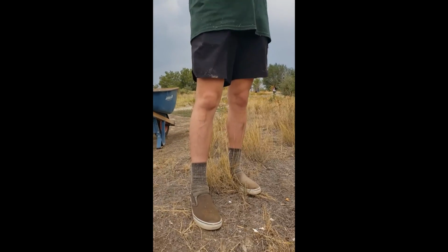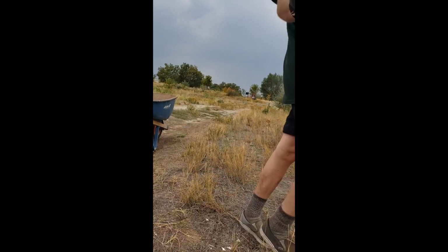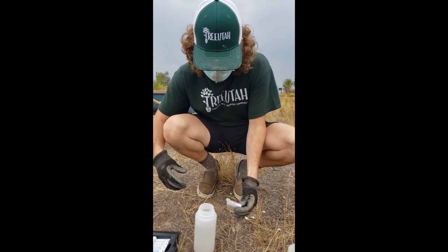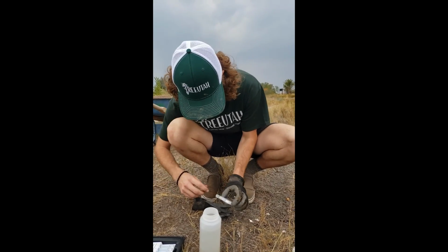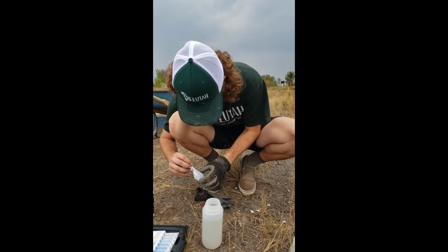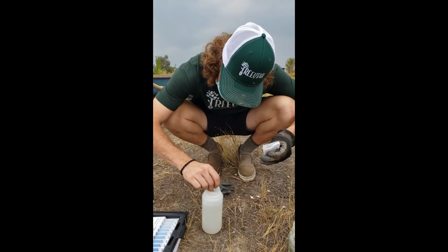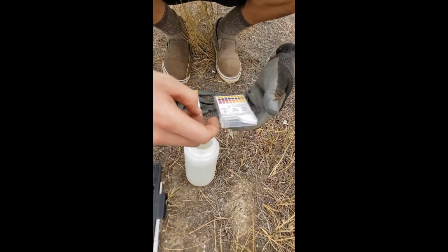Do you want to go collect a fresh sample of river water? Okay, so you can just go right down by the river and bring it back to us. So you have your river water. We've got our river water sample. So I just take one strip. Yep. You have to change from work gloves to scientists' hands. Be nimble to take your data. We just dunk it in. Do we have to hold it there or just take it out? Then you just take it out, and then you get to compare it.